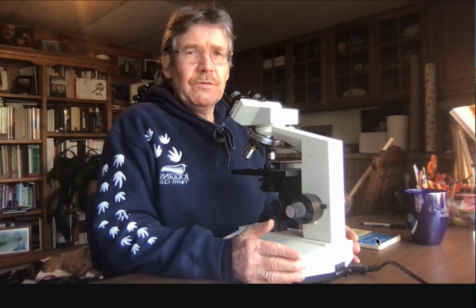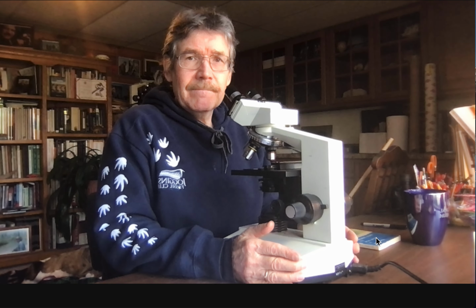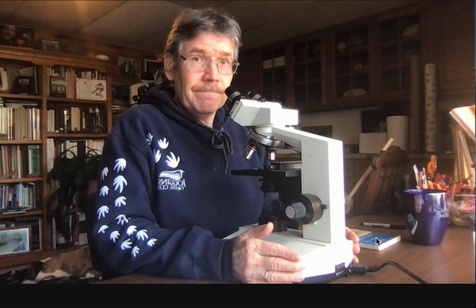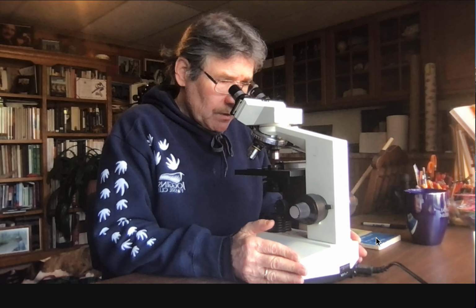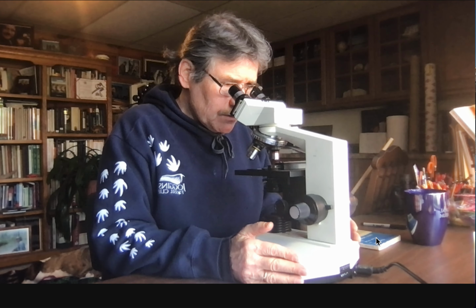So you can do that in two different ways. You can put books under the microscope and raise it up. But as much as you can be straight, the better off you will be. Straight like this. So you want to be as straight as possible when you look. I think we're pretty good right now.